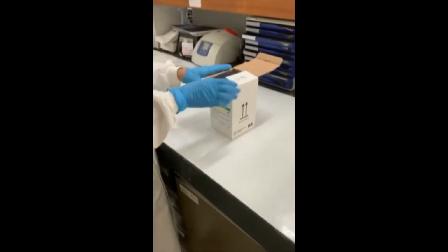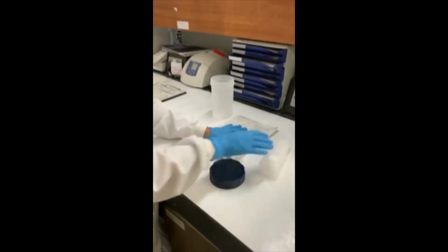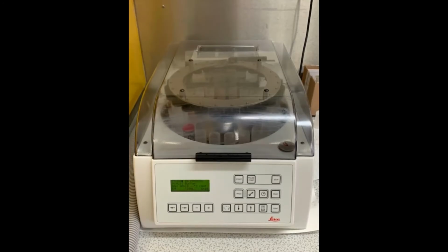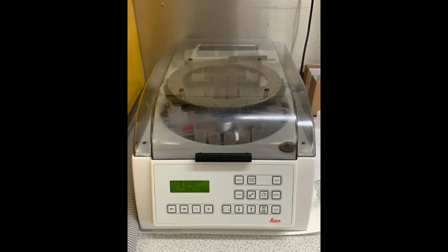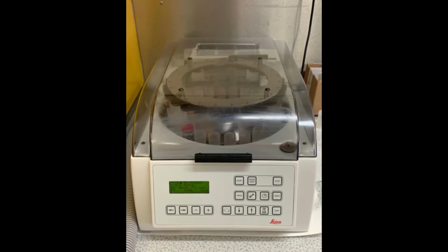Many different types of EM samples are received into the laboratory. They are checked, booked in, and ready to be processed for examination. The samples are processed using an EM processor, impregnating the tissue with resin, which will allow very thin sections of the tissue to be examined by transmission electron microscopy.